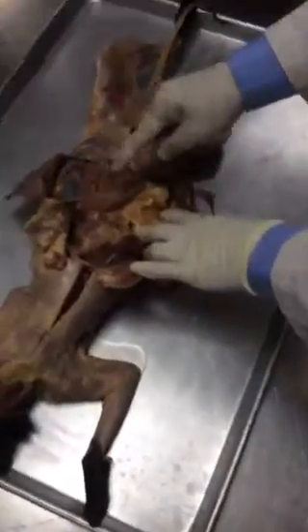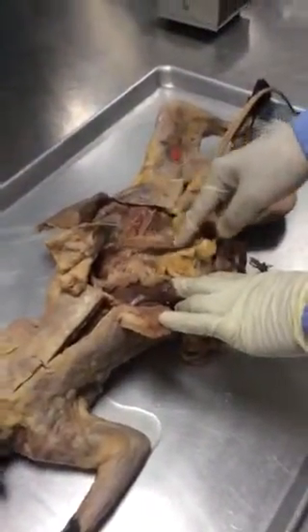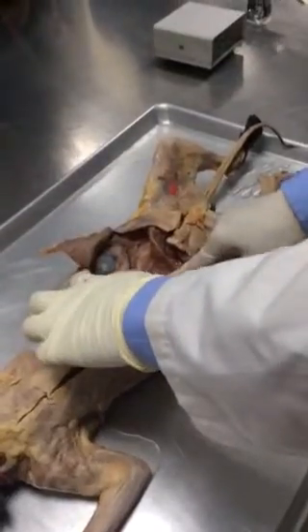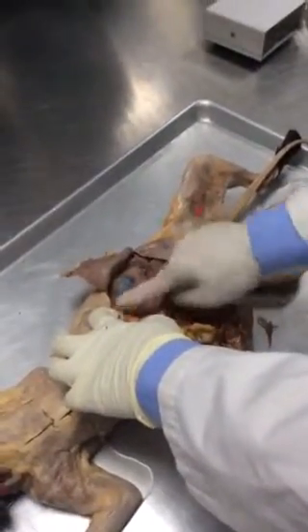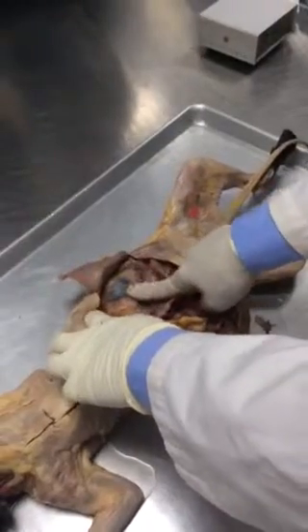This is incorporated with the gut tube, I told you, but it is not part of our digestive system. This is part of our lymphatic system. Spleen is always on the left hand side. Okay. Now what else you see? You see this is the peritoneal cavity, alright? This shiny thing is the visceral peritoneum. The outer layer is the parietal peritoneum. And what is that thing?